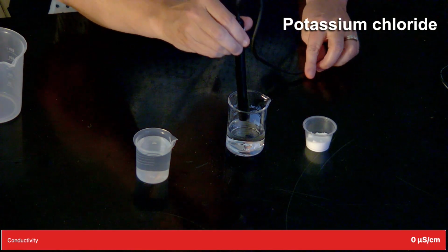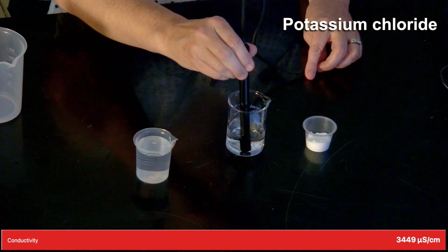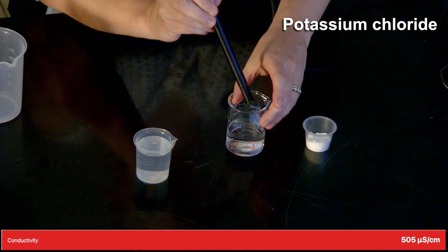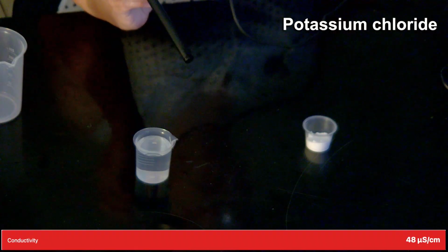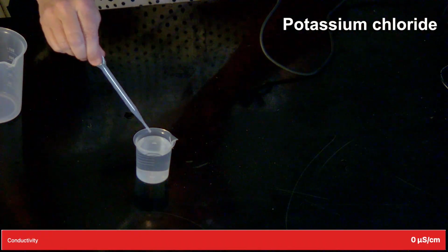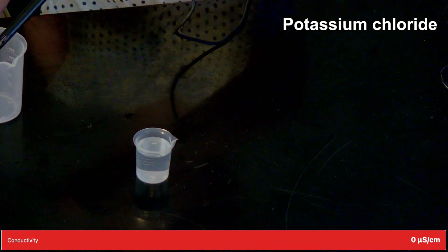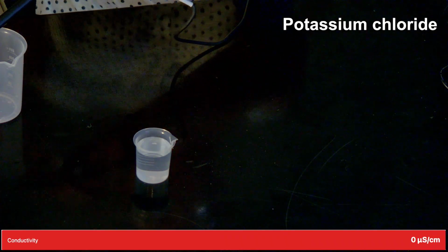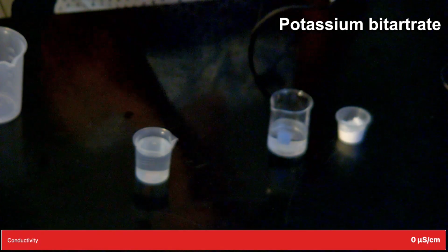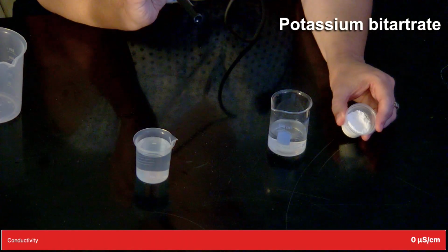We'll insert the probe. And we'll see our value there. And then I'll be cleaning the probe off each time. This is distilled water, and I'll just be cleaning it off each time. Okay, second substance is our potassium bitartrate. Again, this is more powdery, like we indicated before.